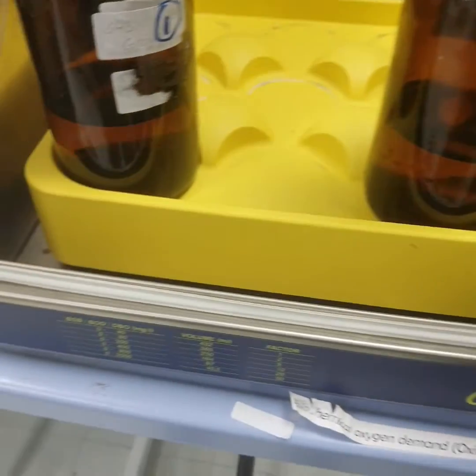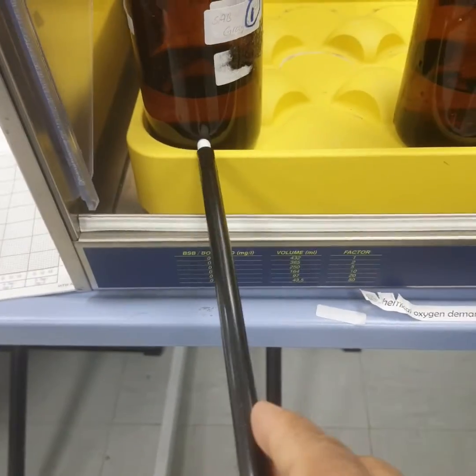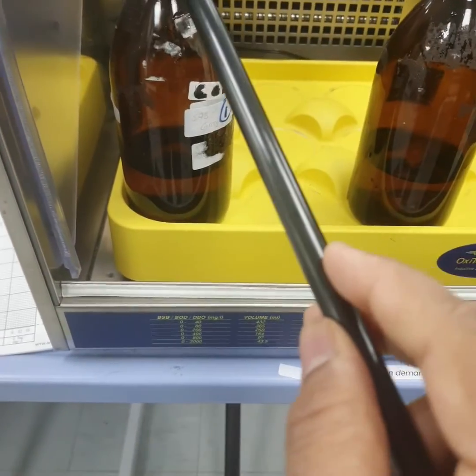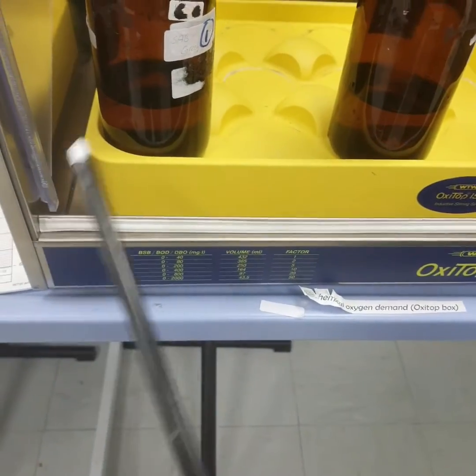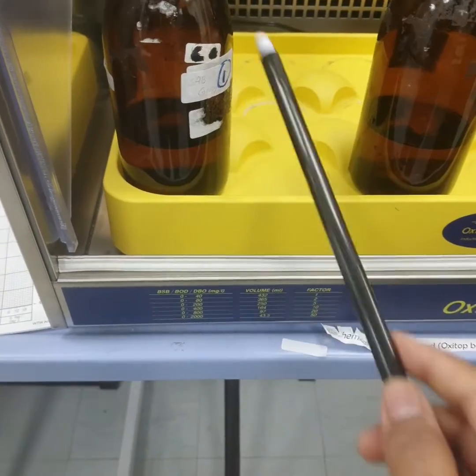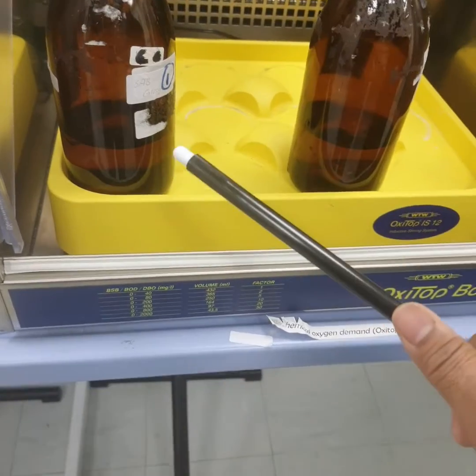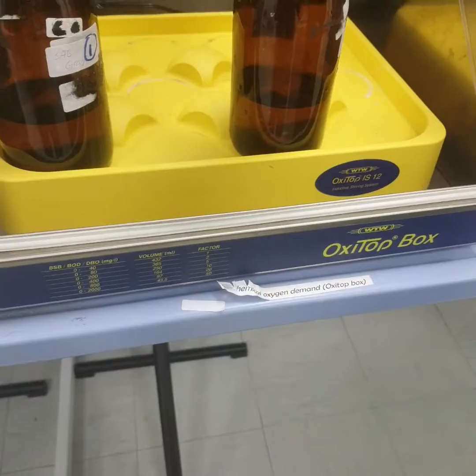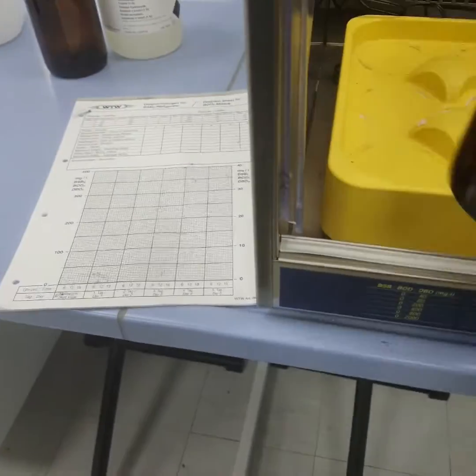Use the magnetic stick to position the bead in the center of the bottle. The purpose of adding the base — sodium hydroxide — is so that whatever CO2 is liberated is absorbed, and there is no pressure fluctuation inside the BOD bottle. The bottle is colored so there is no light activity inside. This is placed in a thermostat cabinet where temperature is maintained.